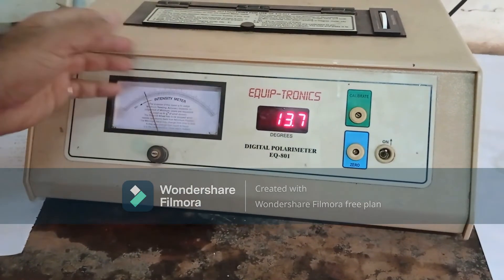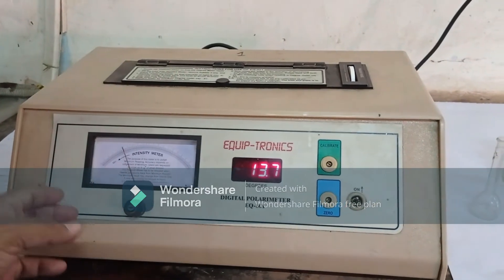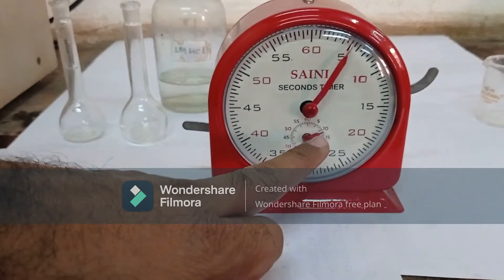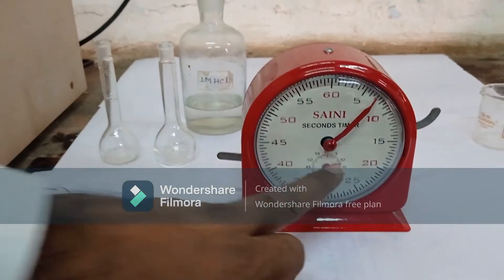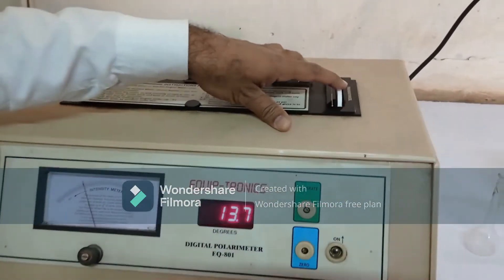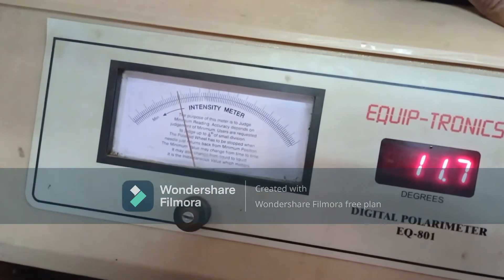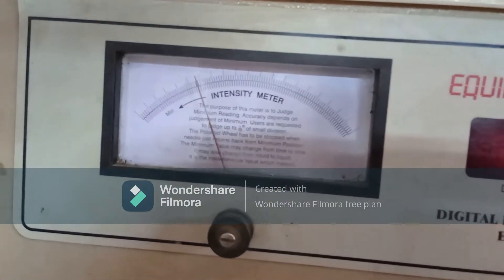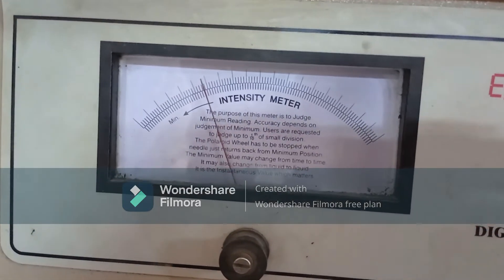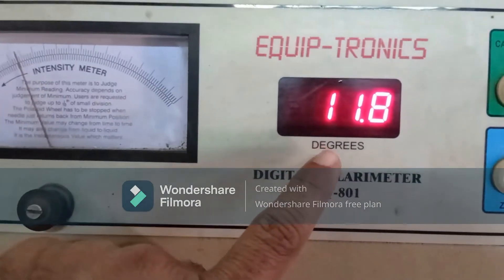Then we have to take readings until 50 minutes at intervals of 10 minutes. Now 10 minutes have passed, so we have to take the reading for 10 minutes. Once again, we adjust this Polaroid wheel to the minimum value. This is the reading for 10 minutes.